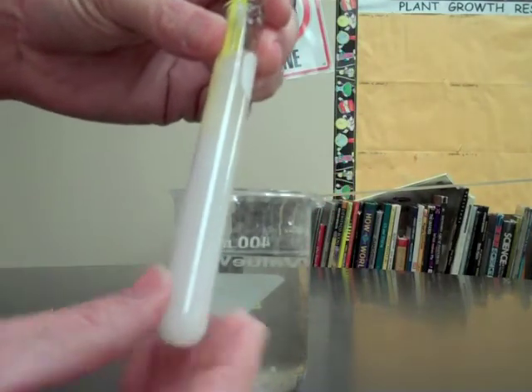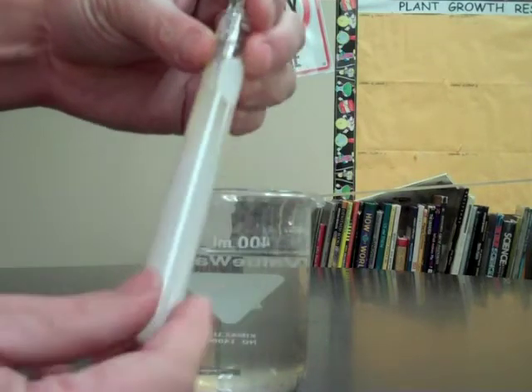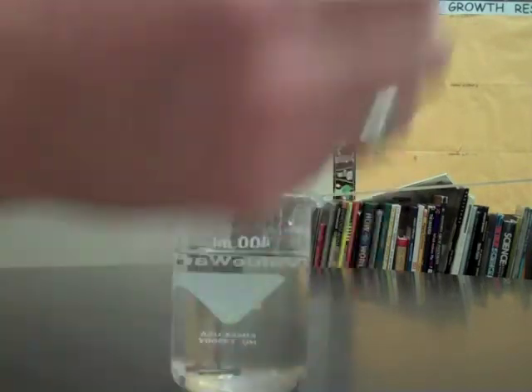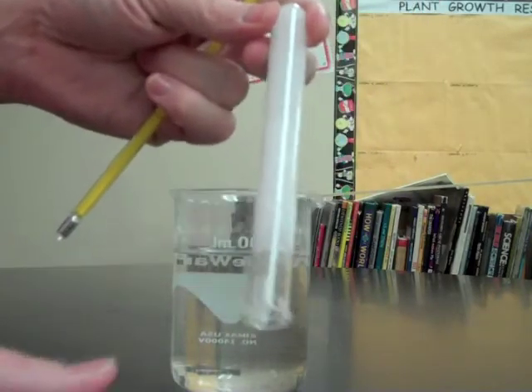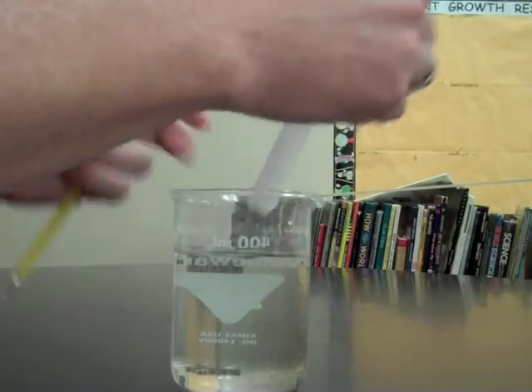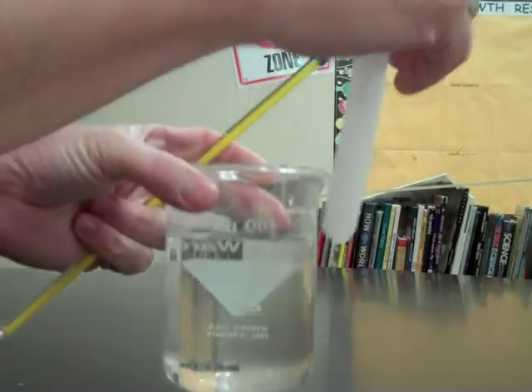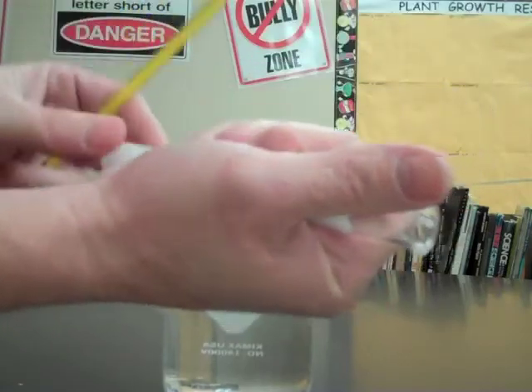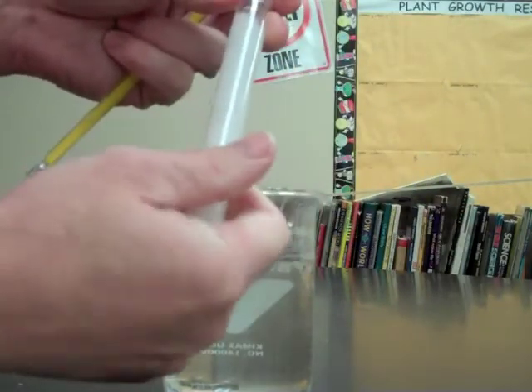We notice a great temperature change in what has happened here. It turned from a liquid to a solid immediately when I took the thermometer and put it inside the test tube. It's no longer the same temperature as the water in the beaker. It's definitely much, much hotter. You can still grab it with your hands, but it's definitely hot.